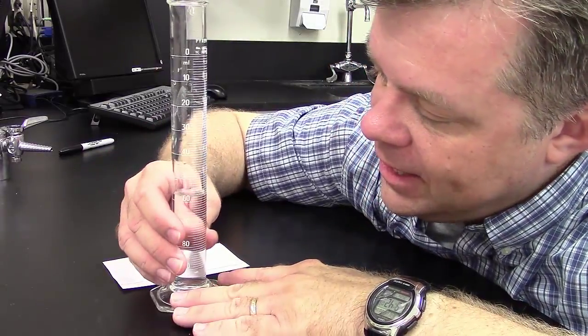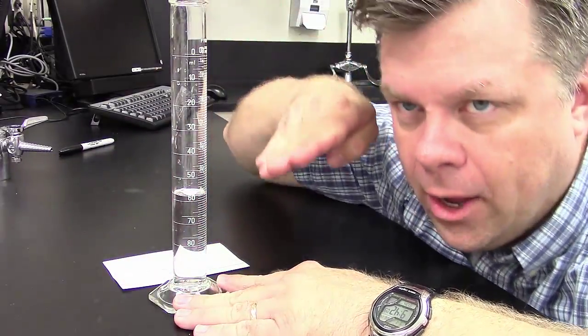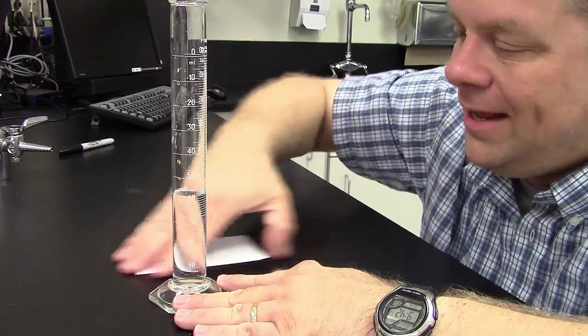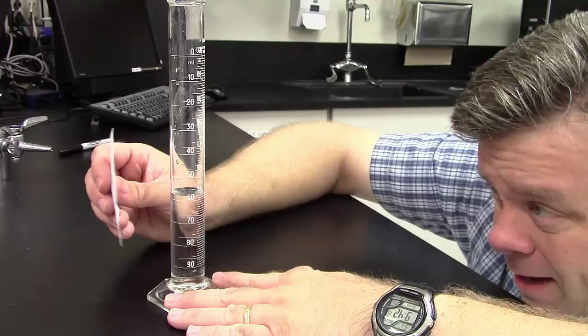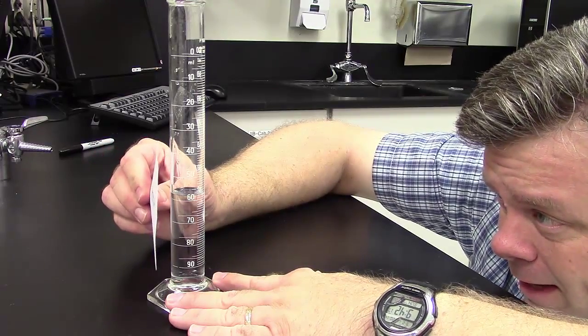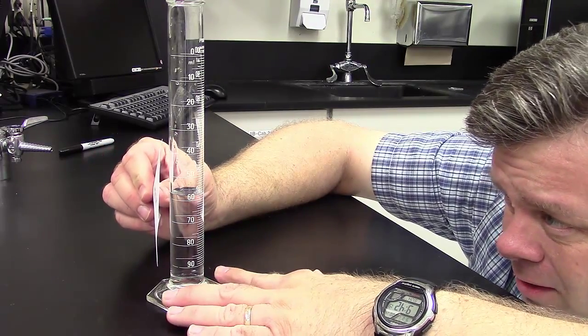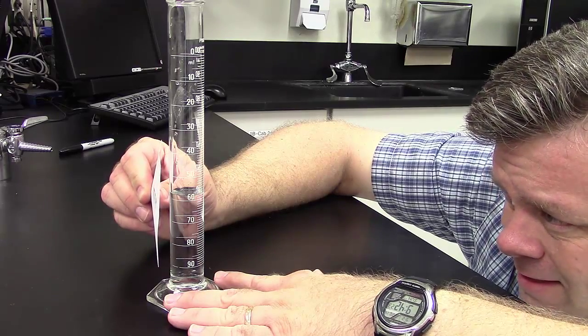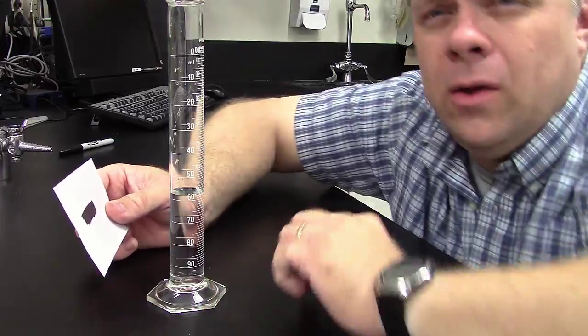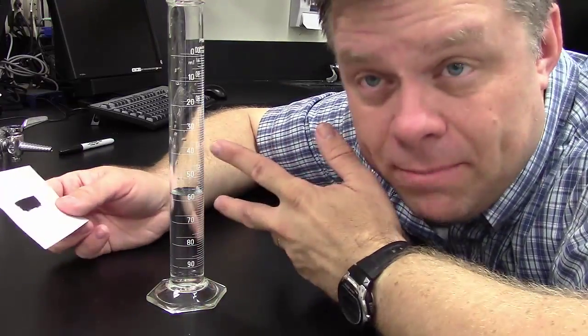So in this case, again, same idea. I'm going to get down at eye level. I'm going to move my little black line in back so I can line it up. Oh, I only see one line. Then I've got the black line behind it, and this one looks to me like it's going to be 41.7. Now wait a second. Why didn't I go 41.7 something?